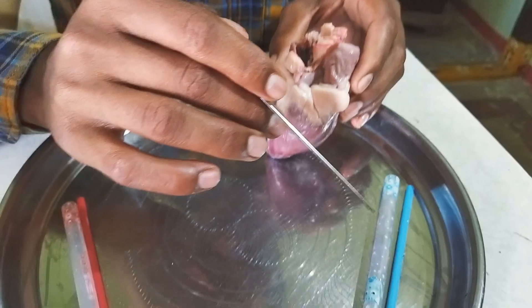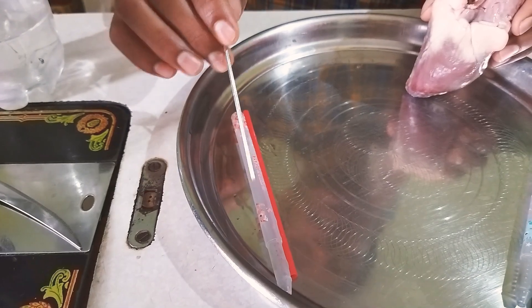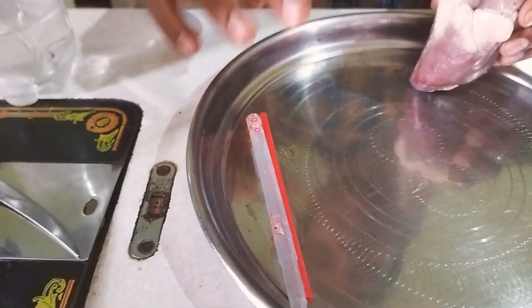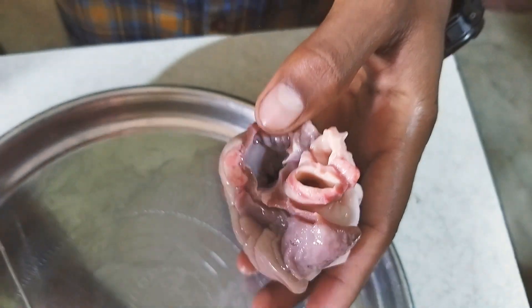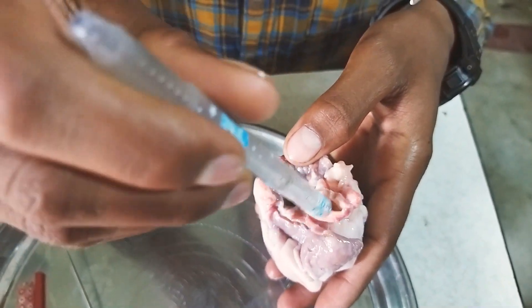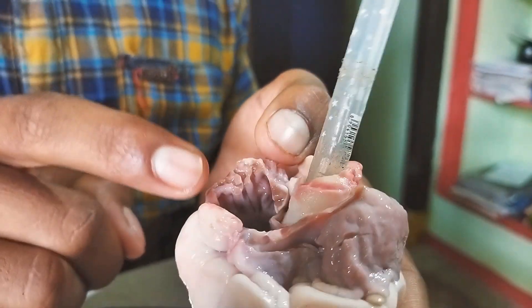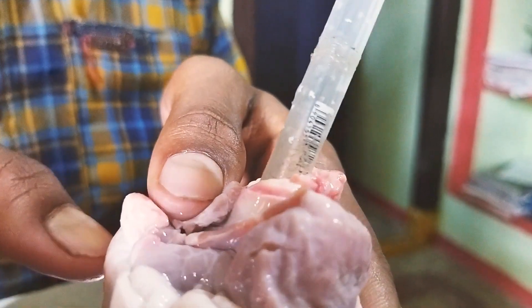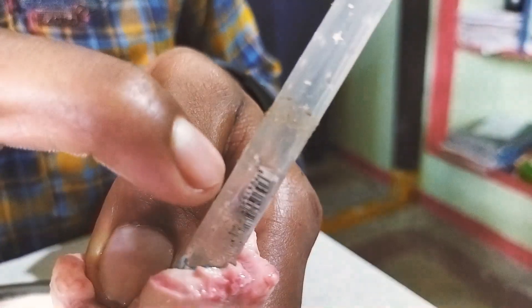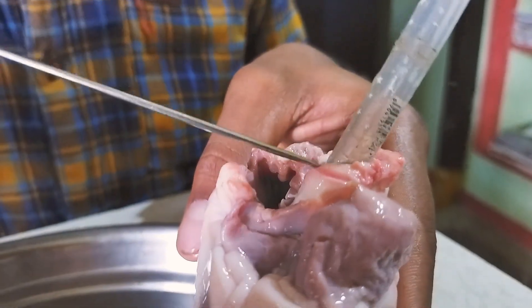Let us do a small activity. I have taken four straws. These straws indicate deoxygenated blood, and the red color straws indicate oxygenated blood. I am pouring some water in the superior vena cava. Observe carefully — I have taken a straw and put it in the pulmonary artery. We can observe that the water is coming from the pulmonary artery. This pulmonary artery supplies deoxygenated blood to the lungs.